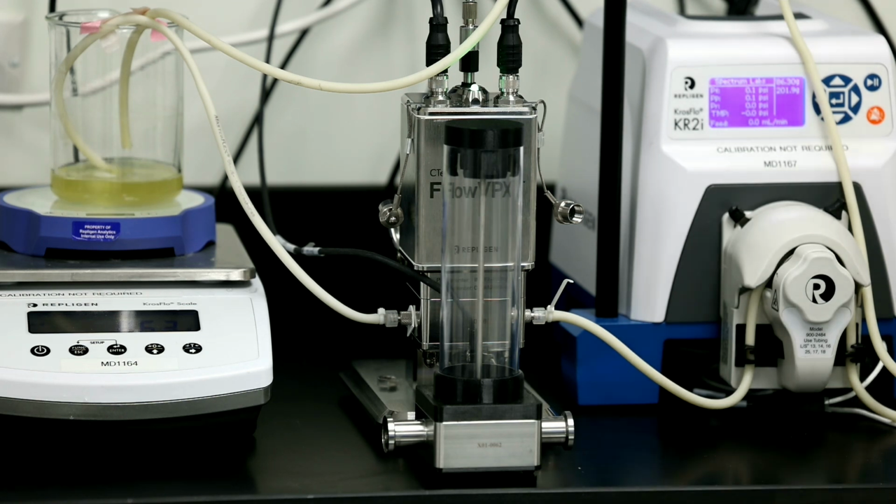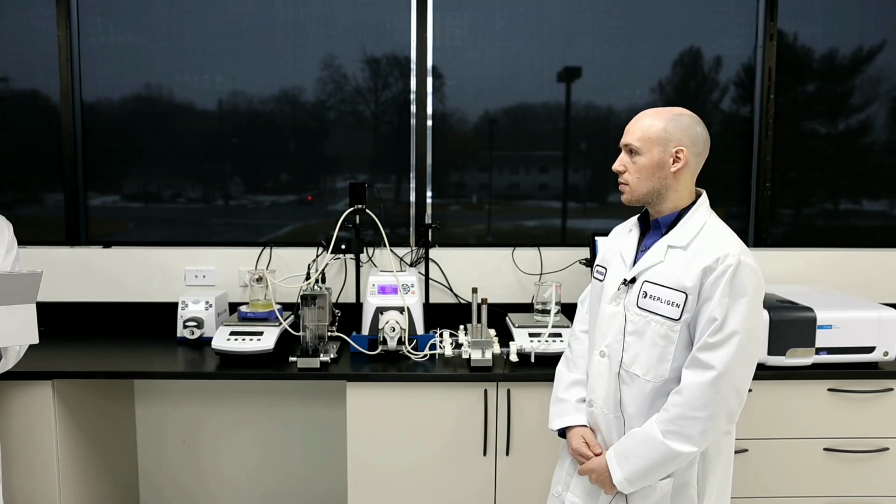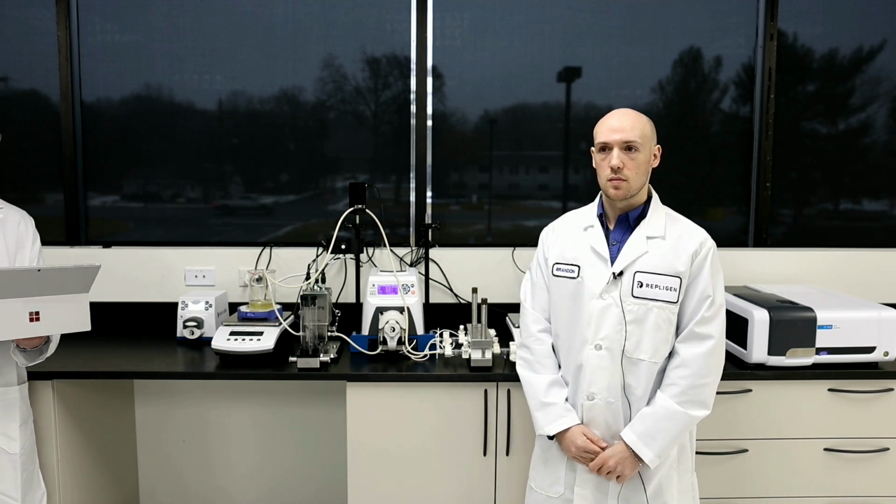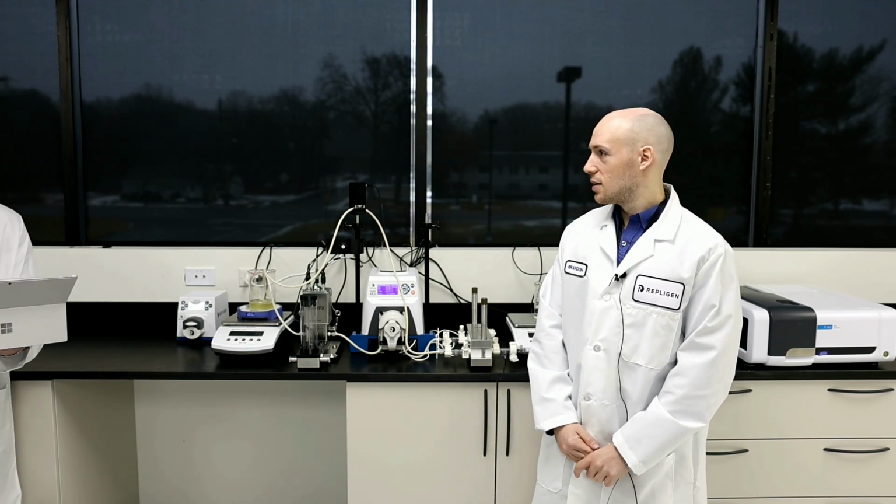Thank you. Great, thanks, Brandon. The next question that I have here is related to these flow cells. People are asking, are the fibrettes disposable? I think they're used to solo VPE measurements. Yes. And they're asking if the fibrette is disposable.